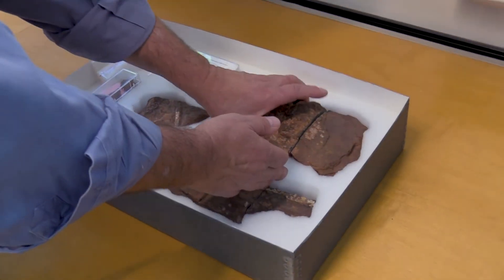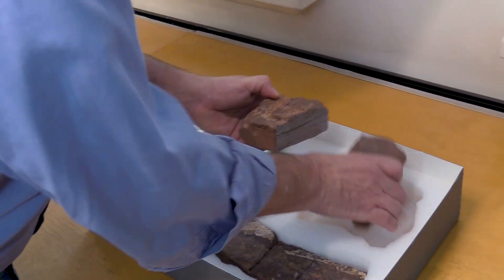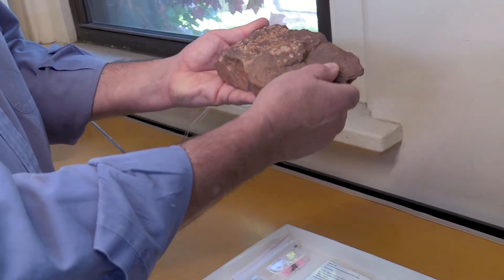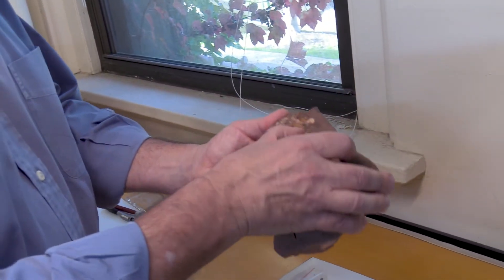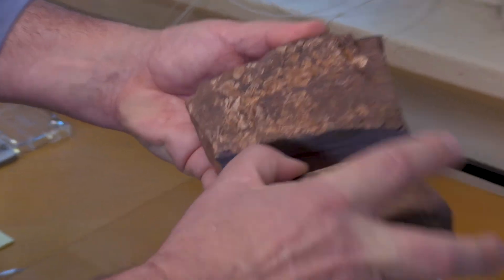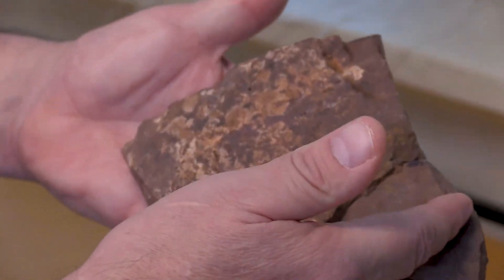It's mind-blowing that I can lead whole expeditions inside the cabinets of my own laboratory — finding new fossils just by opening the cabinets and scanning rocks that have been sitting in my office for years. We now have a whole vista to discover. We thought we had known everything by collecting rocks and preparing them manually, but once we can scan inside them we see whole new things we didn't expect. I look at my collection in whole new ways.